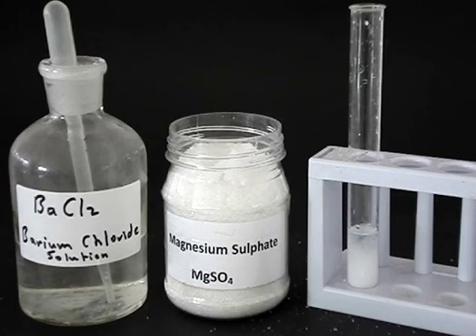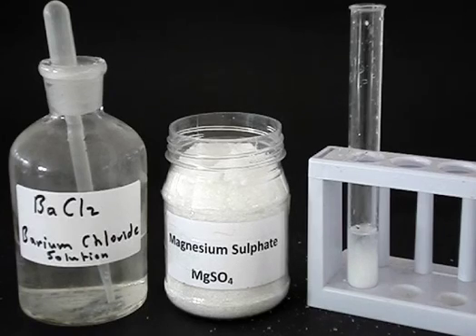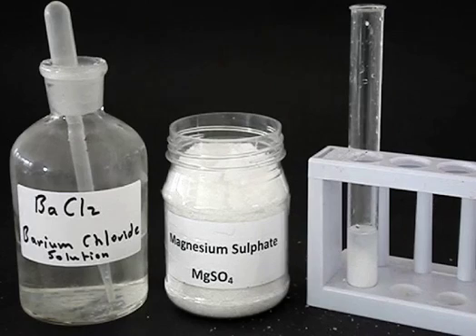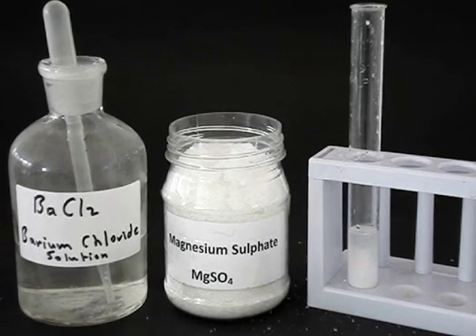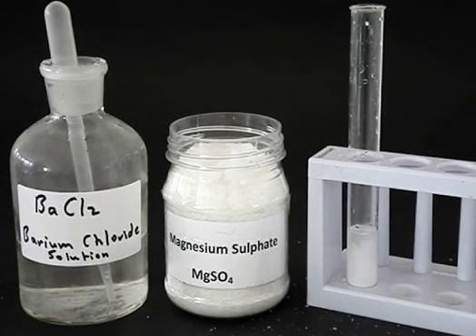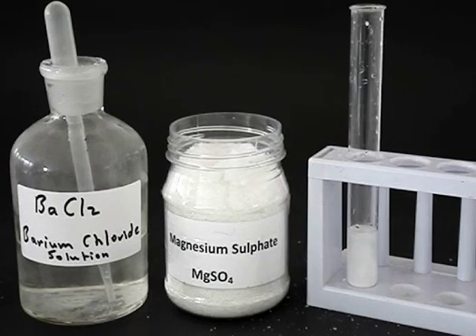And there we've seen that it's been formed — it's a white precipitate, barium sulfate, that cannot dissolve in water. The presence of that barium sulfate indicates to us that sulfate ions had been present in the original solution. So the test for a sulfate is: add barium chloride solution to a solution of the unknown salt — if a white precipitate forms, then probably the unknown solution was a sulfate.